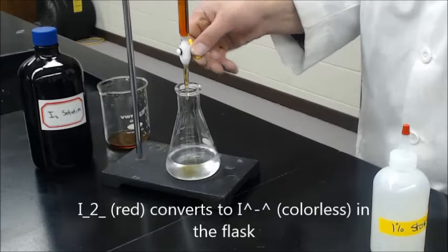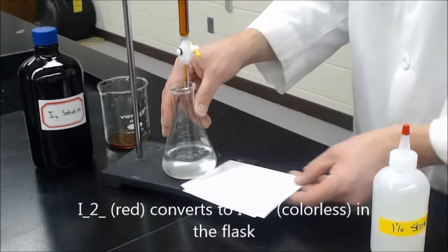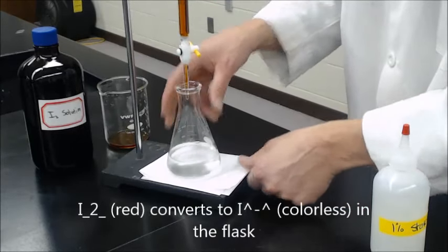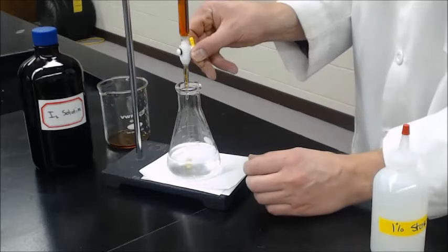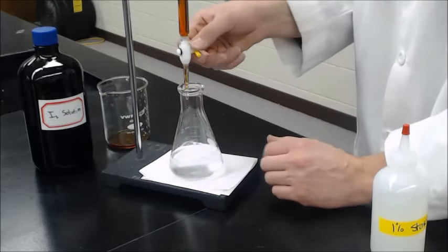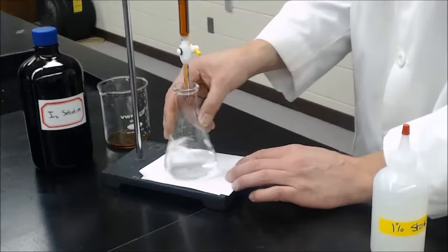If the titration is hard to see, the color, you can go ahead and put a little piece of white paper in there. I think the glare is bad in the video for this, but it really helps me to see what is going on.